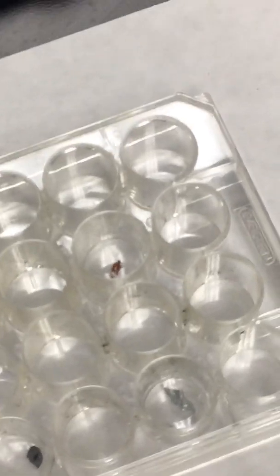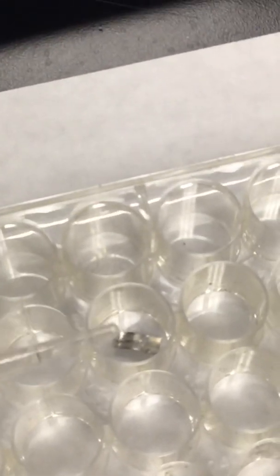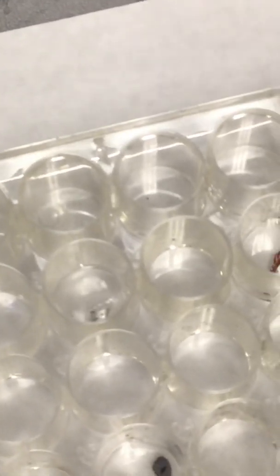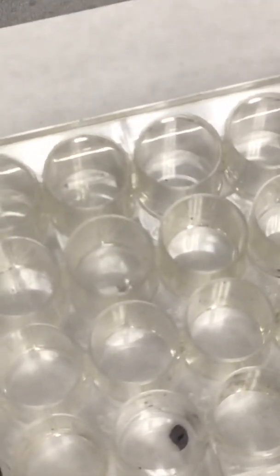Okay. What's after copper? Magnesium. You want to do the honors this time? Which one, this one right here? Let me find it. Okay, got it. Okay, you can really see the bubbles there. Okay, and then we're going to take a little bit of sulfur.